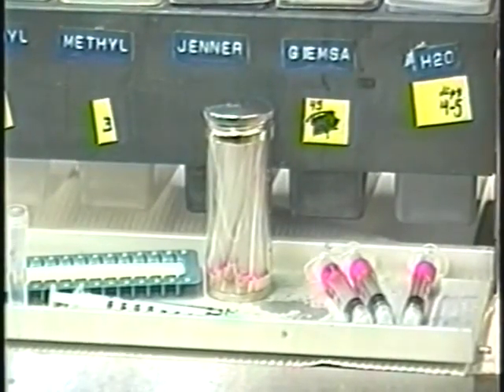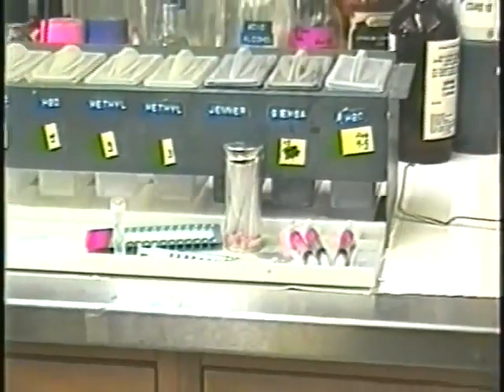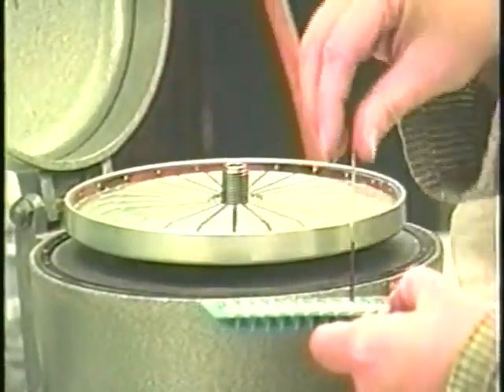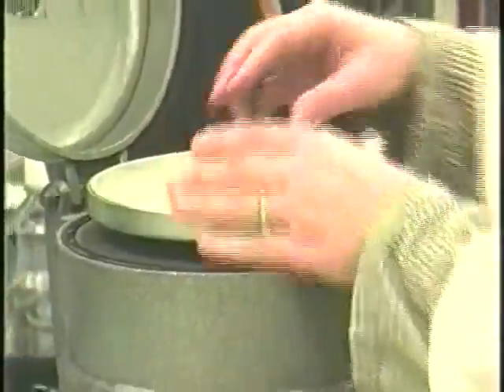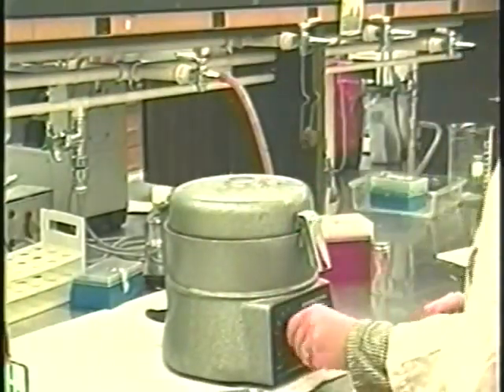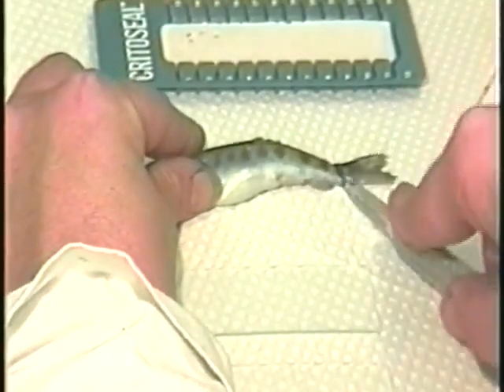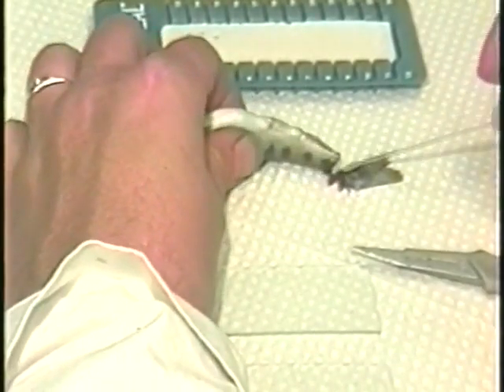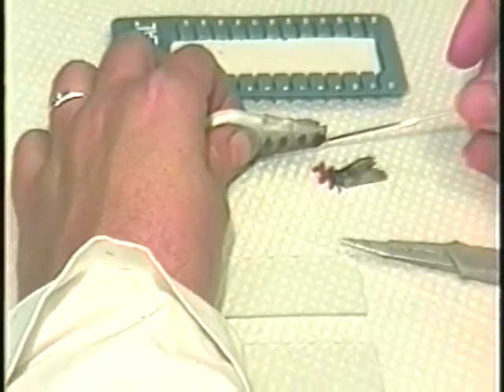Whole blood or plasma is collected using capillary tubes or syringes containing the anti-clotting agent heparin. A capillary tube is commonly used for determination of hematocrits, making a blood smear on a slide, or collecting blood from a small fish. To collect blood in a capillary tube, the easiest method is to cut the caudal tail completely off between the anal fin and the base of the caudal fin, then hold the tube against the dorsal aorta until filled.